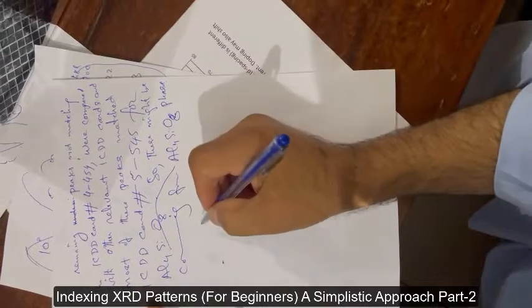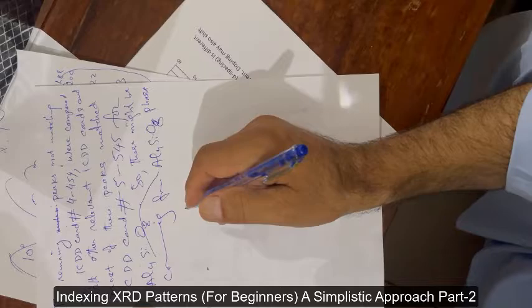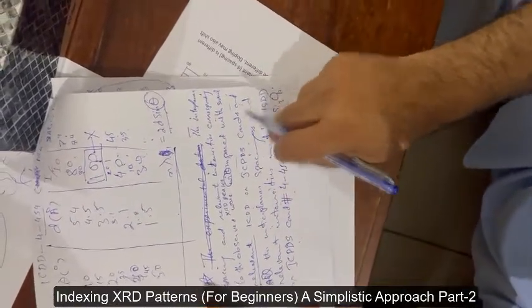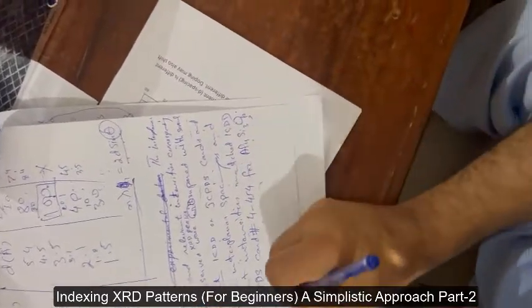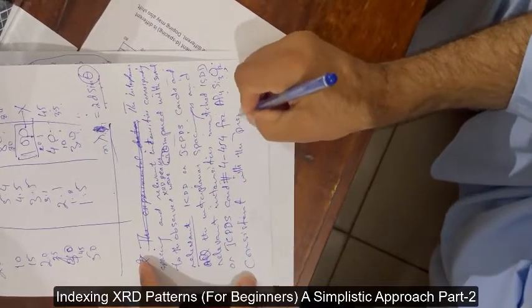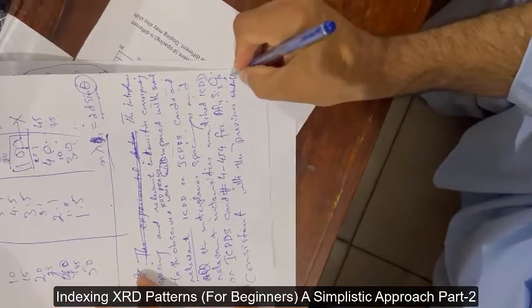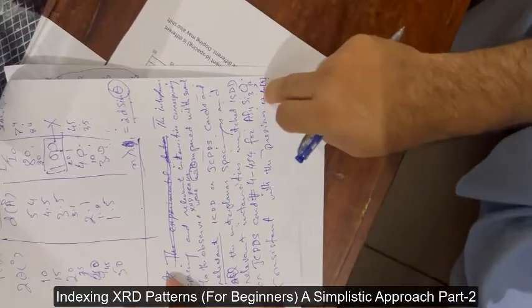When you get this result, go to the literature to see what other people have found studying the same material — for example, granite. When you write that these peaks match a particular phase and some other researcher has also worked on this material and found the same thing, you write 'consistent with previous studies' and cite the reference number in parentheses.